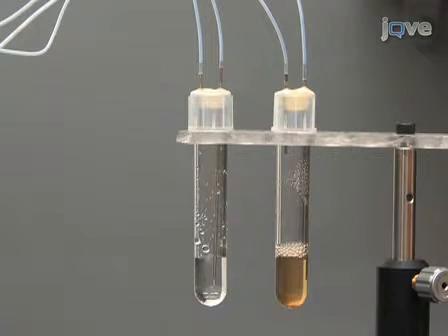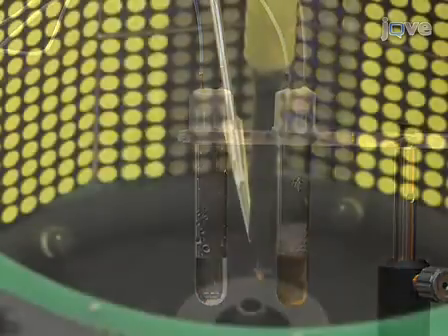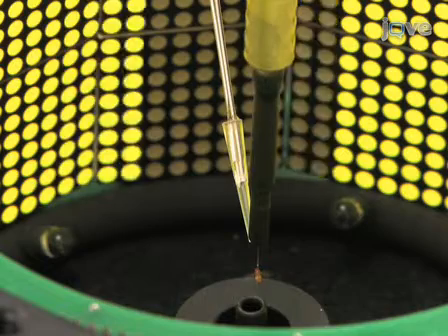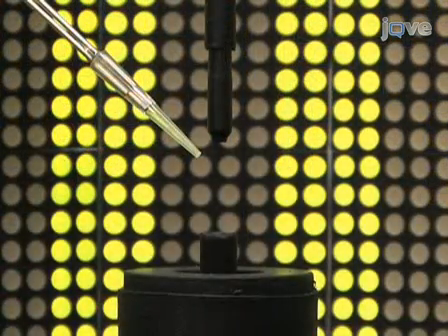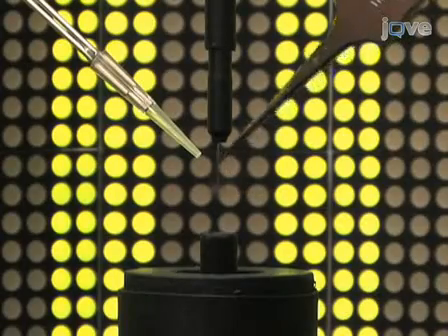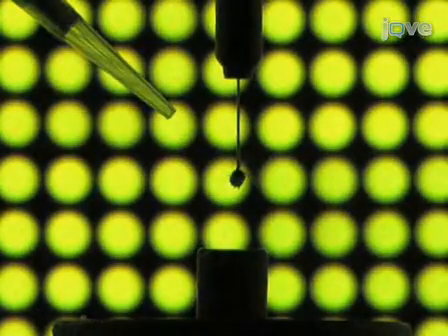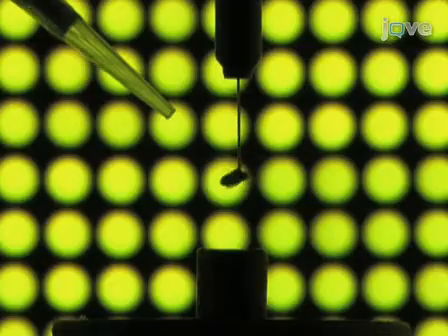A second basic experiment in the OMT is to visually drag a fly into an odor plume, instantaneously change the visual conditions, and then measure its ability to remain in the plume. Experiments are done in a random block format to minimize any bias in experimental order. Using forceps, place a freshly tethered fly in the arena. Next, as a diagnostic check, visually rotate the fly several times around the arena. This ensures that the animal has the capacity to orient in every direction.